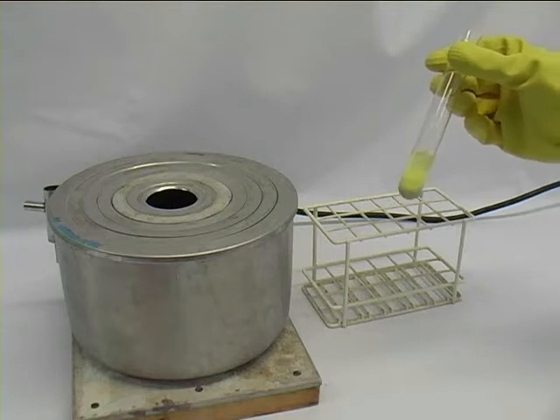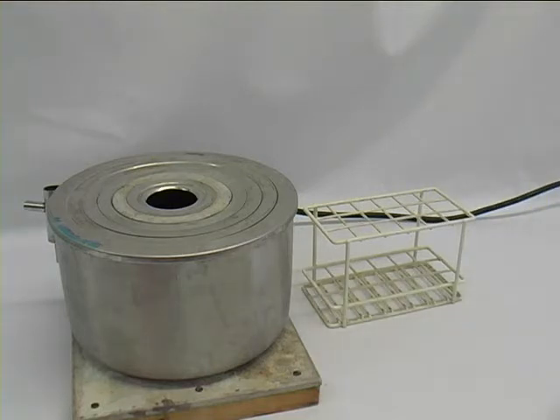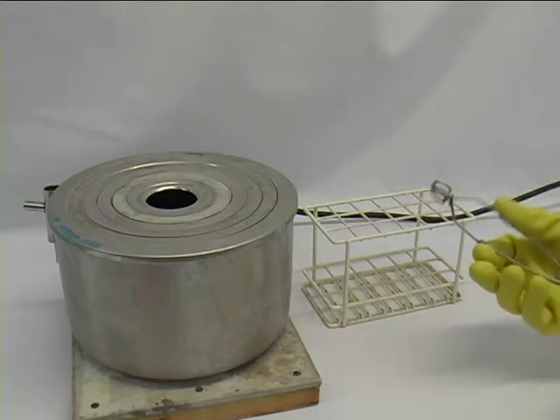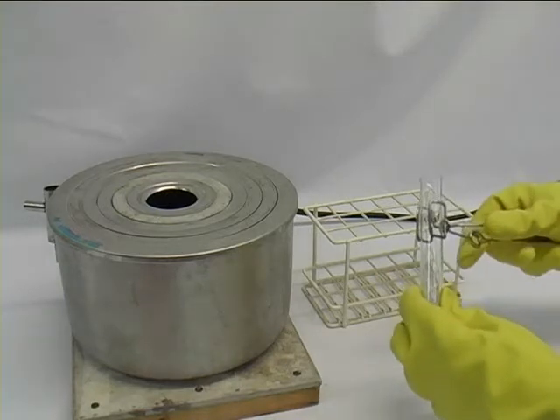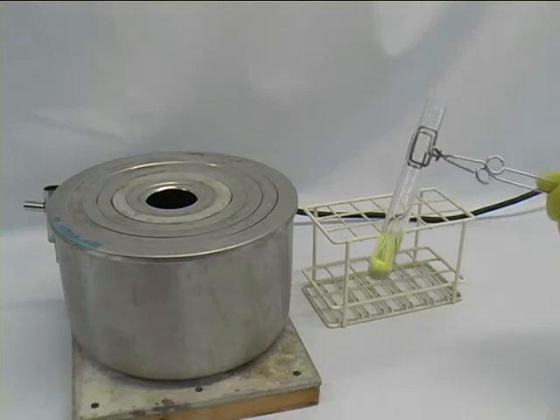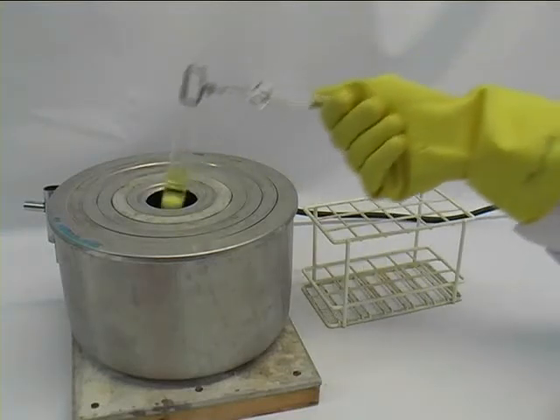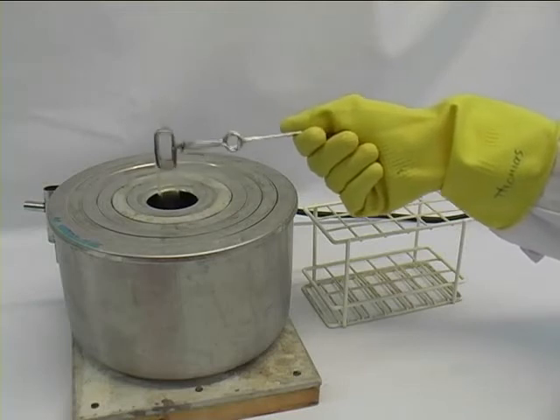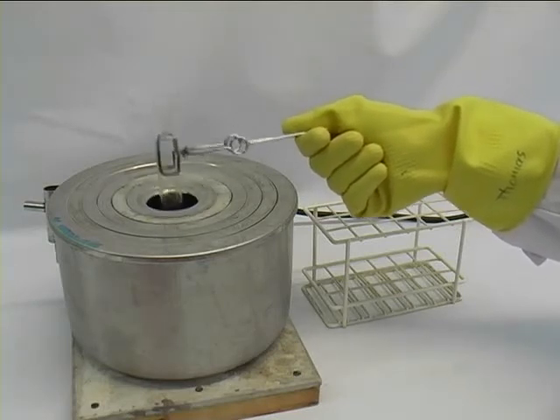Recrystallization is about using the minimum amount of hot solvent to dissolve your component and then separate it from an insoluble compound. Here we clamp it into a test tube holder. The water bath has around 100 degrees. We can use the steam above the bath. We shake it until one of the two components has dissolved. That might take some time.